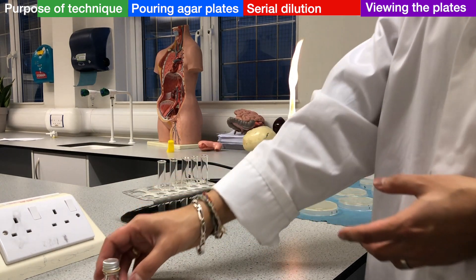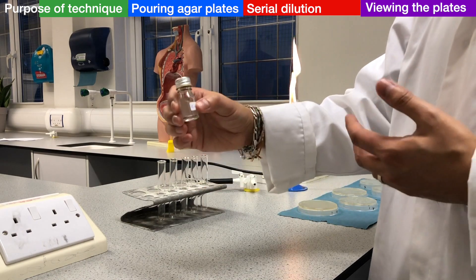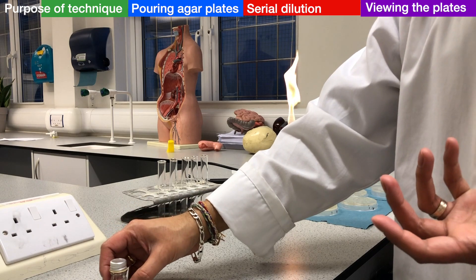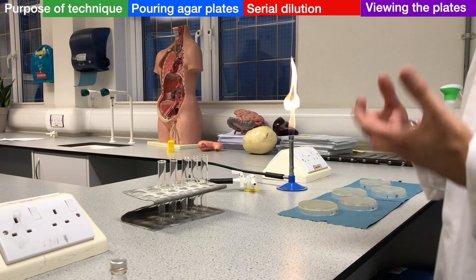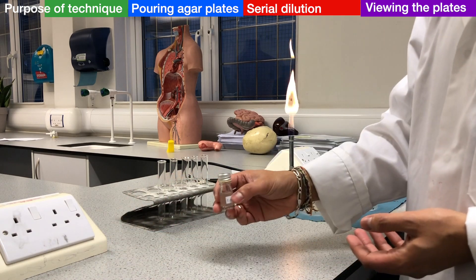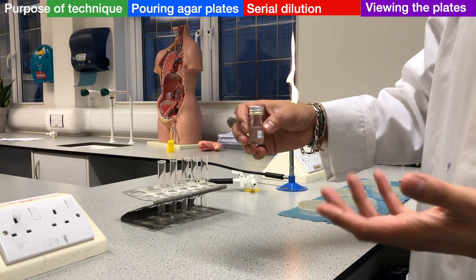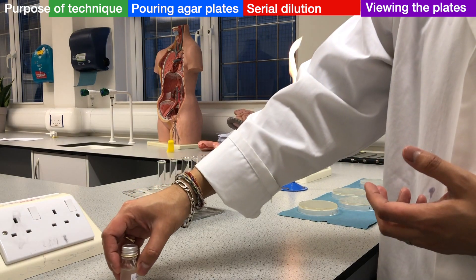At that point, we will want to measure how much bacteria there is — how dense is our culture. The more dense the culture of bacteria, the more bacterial growth has occurred. The lower the density of the bacteria, the more negative impact that factor or condition had on the growth of the bacteria.